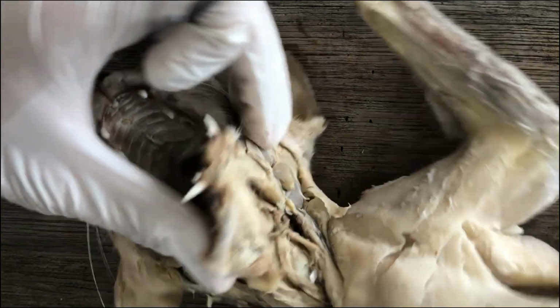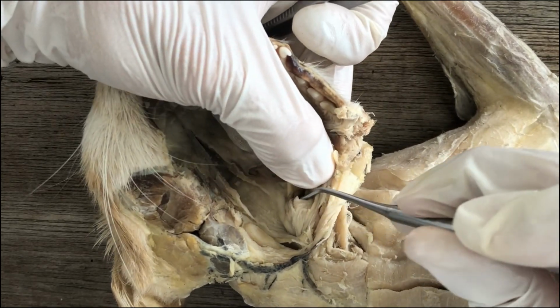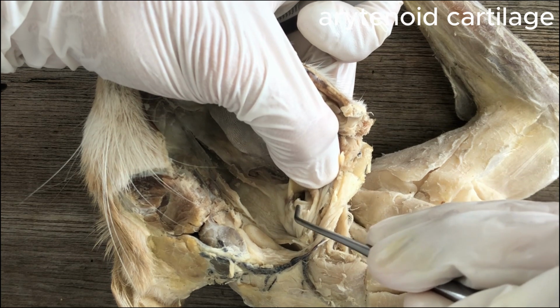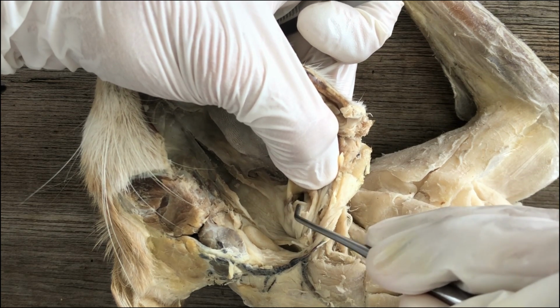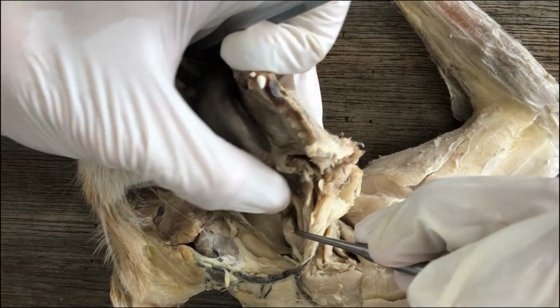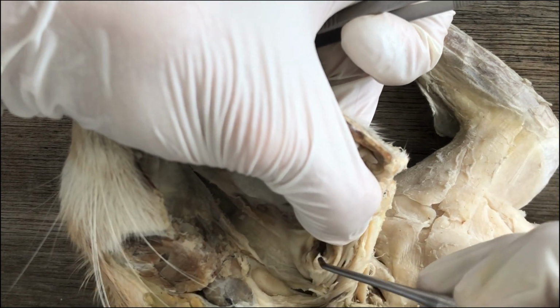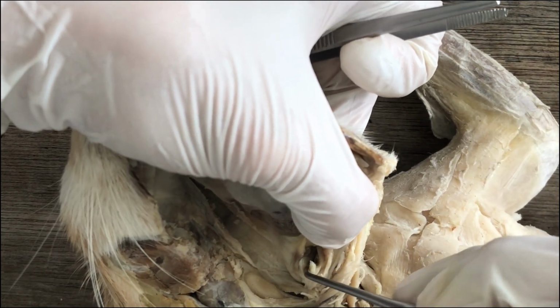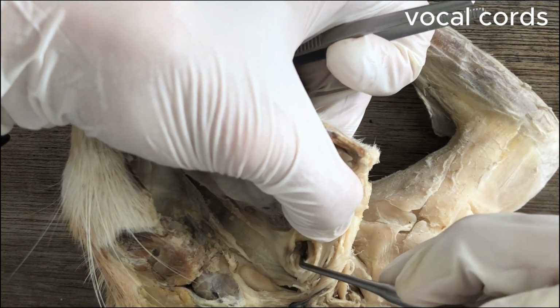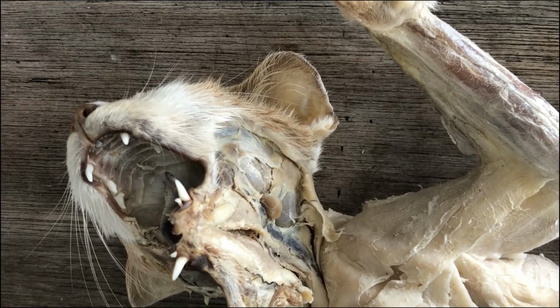And then another set of cartilages of the larynx guard the glottis opening. These are the arytenoid cartilages. There are two arytenoids there guarding the glottis. And then there are lateral folds partially blocking the glottis, the airway. Those are the vocal cords, helping the animal produce a variety of sounds for vocalization.